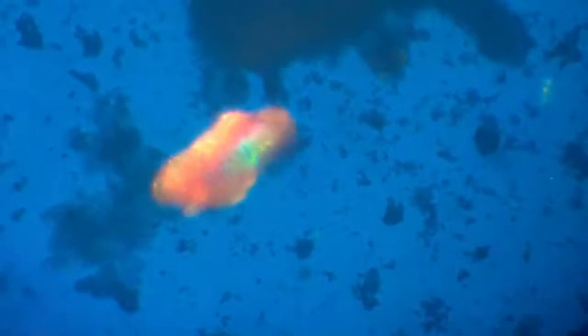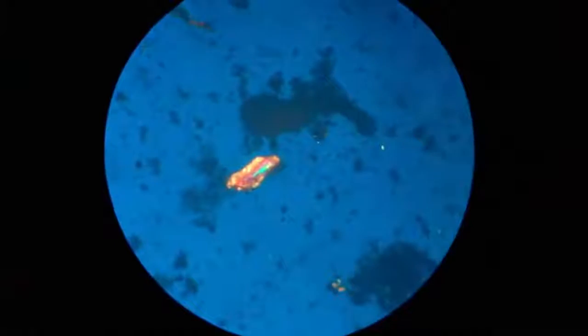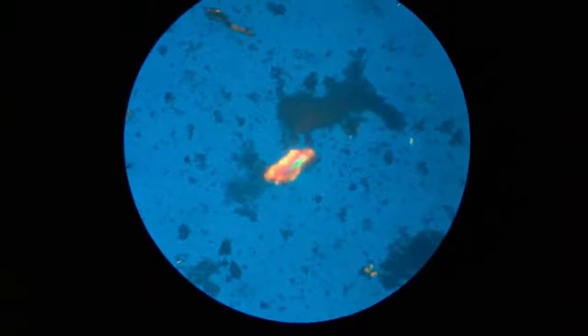If we zoom in, magnify, then it is this. It helps in identifying some minerals, because each mineral has a signature of changing the wavelength. So this technology is used a lot in geological studies. And what I've found is that paramecia, they also shine with these crystals inside, because they eat them and they outshine.